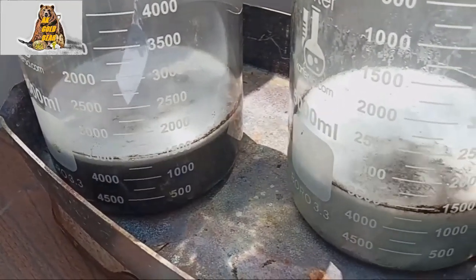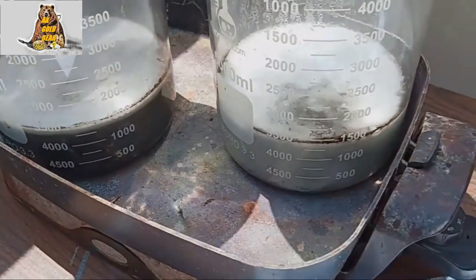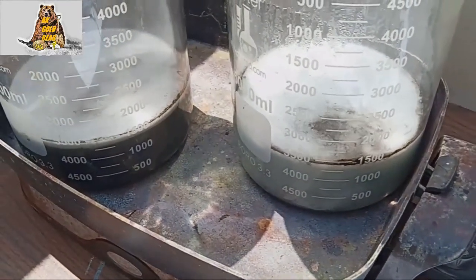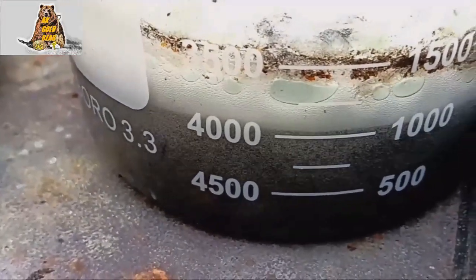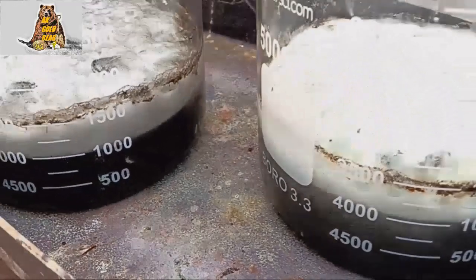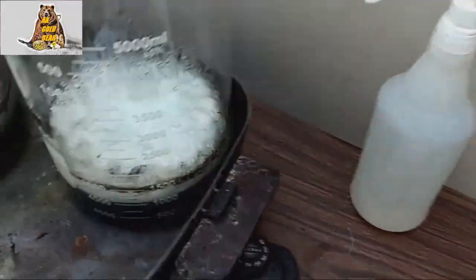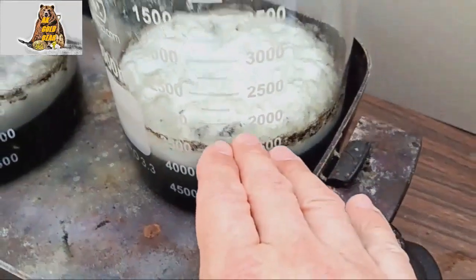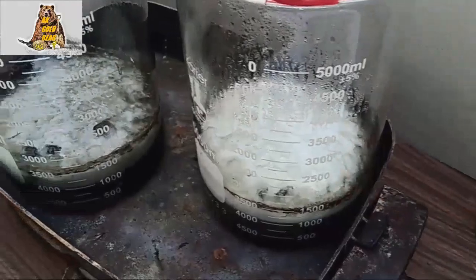In next three or four hours, the reaction will be complete, and our solution will be ready for filtration. Dissolution reaction going well, metal dissolving. That is why I say keep extra water near, because sometimes reaction too strong and to knock down foam need to spray water.